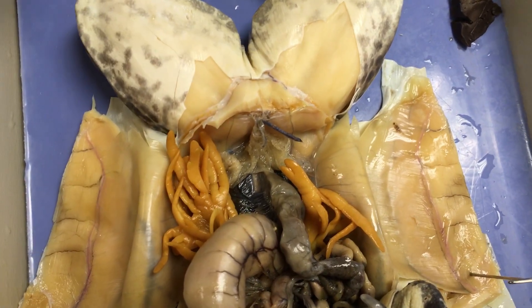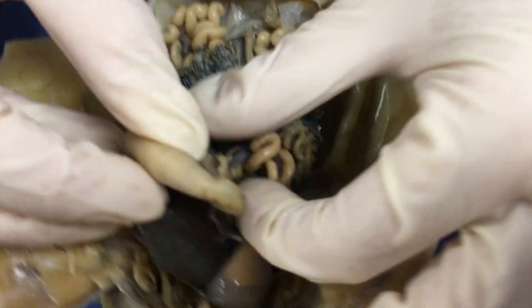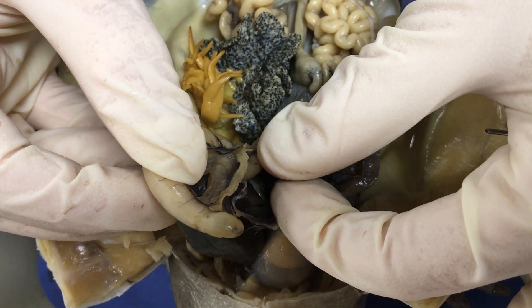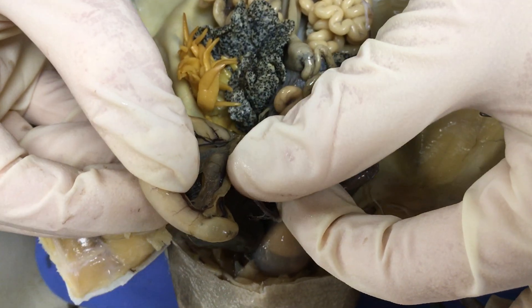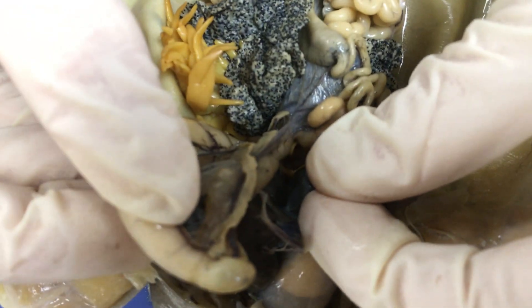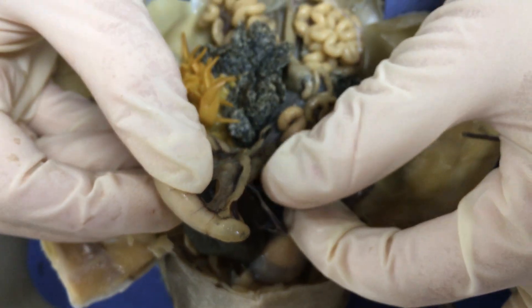I think I missed the pancreas. At the base of the stomach, right where it touches the small intestine, sometimes it's hard to see, but this kind of string-like or almost noodle-looking structure is the pancreas within the frog. It helps with digestion, releasing juices into the small intestines to begin breaking down food.